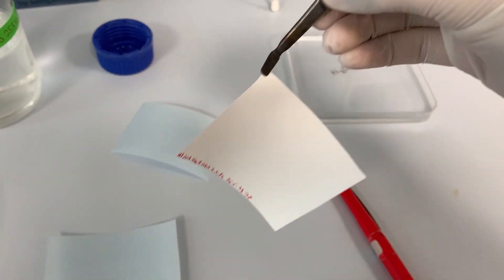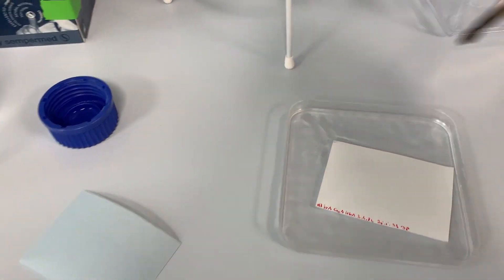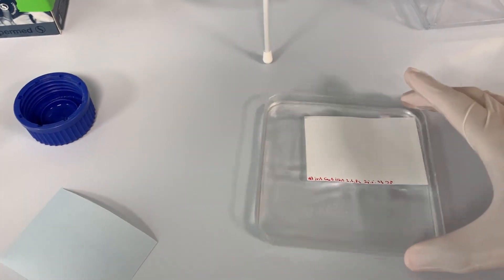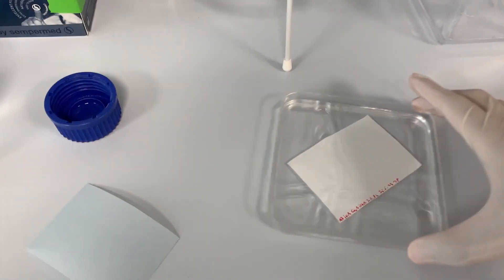But first, I need to activate the nitrocellulose membrane in water. Be aware that a PVDF membrane must be activated in methanol.